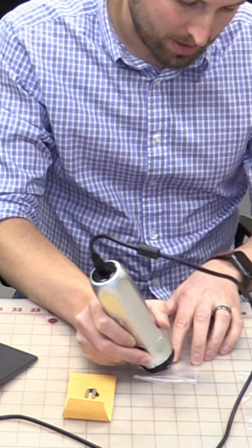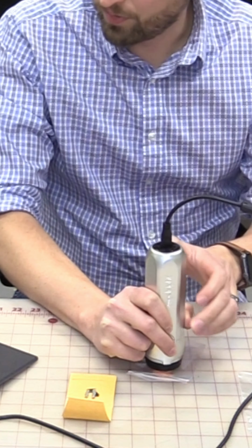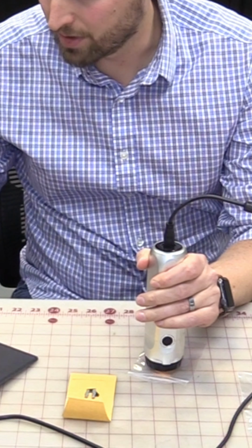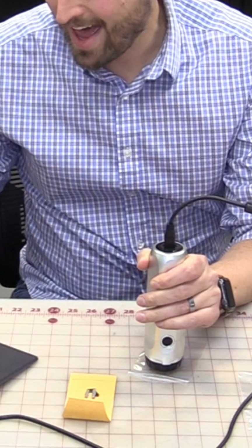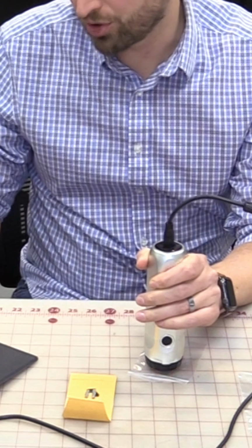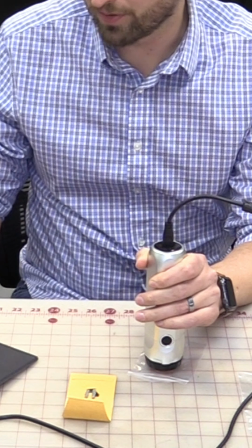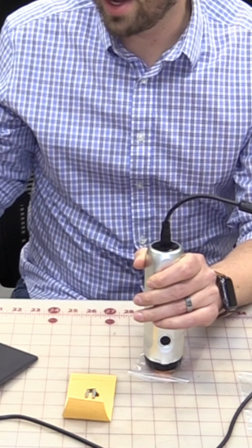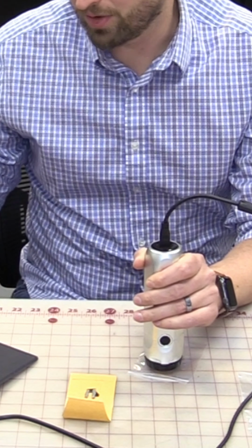So we can see a couple different areas where we have droplets that look like they've formed. You can see here this kind of droplet off to the side. Everything you can see has this very smooth and rounded texture, just as you would expect in a case of something that turned into a liquid and then turned back into a solid. We have those round, smooth edges.